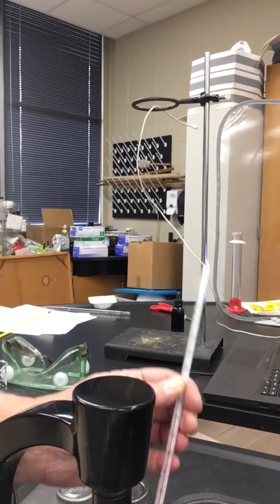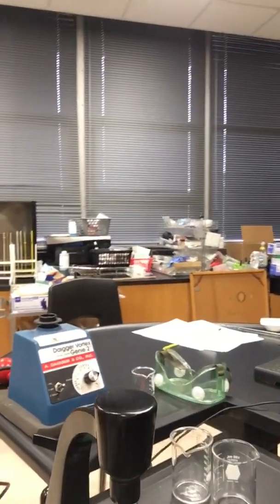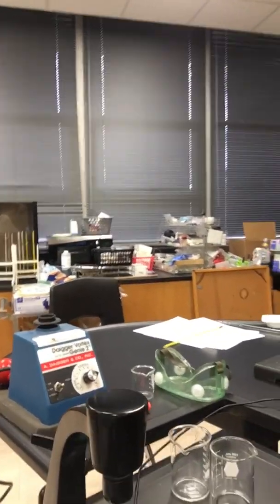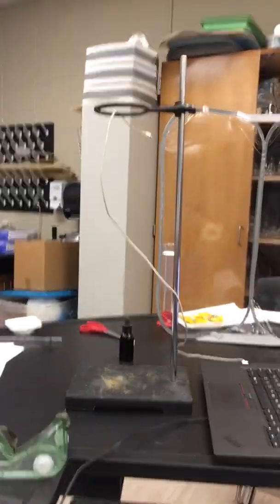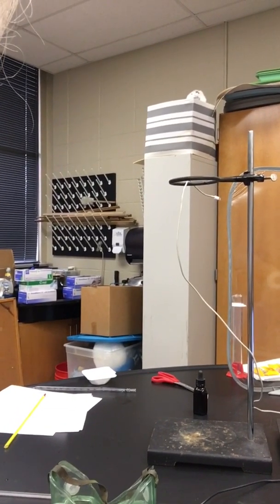Normally once it gets pretty warm, that warms up to around 40 degrees Celsius. So right now that's kind of a cooler, warm water. But we're going to go ahead and take that just so we don't waste more water. I'm going to turn off the video and walk you over to the freezer.